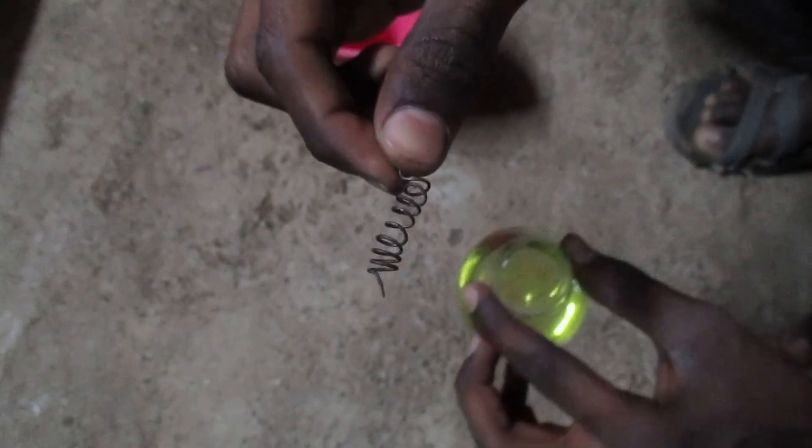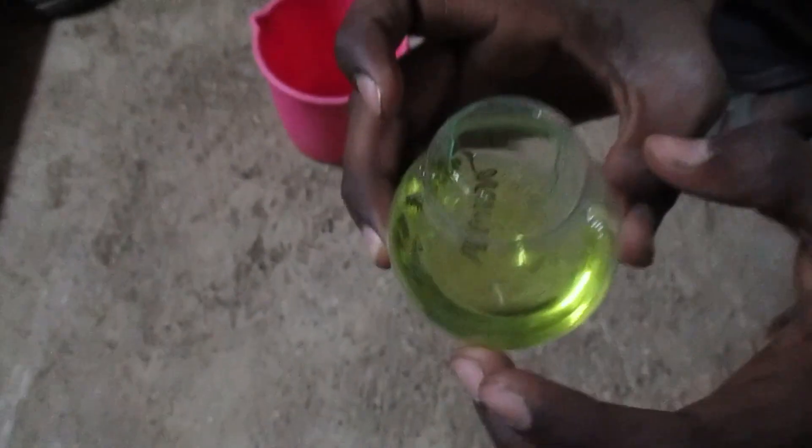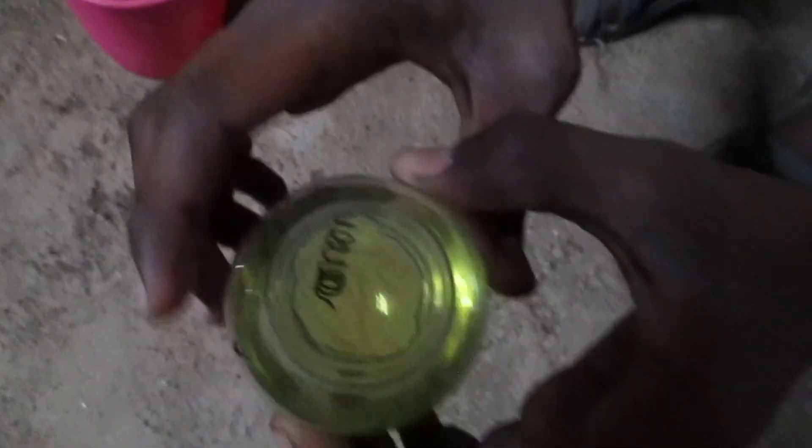See, it is somewhat yellowish — you can see. Now this is the tungsten. We are going to put it in the test tube. Drop it in. See, take a look — that is the tungsten, you can see.